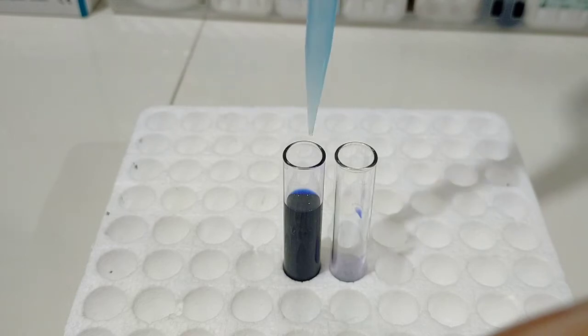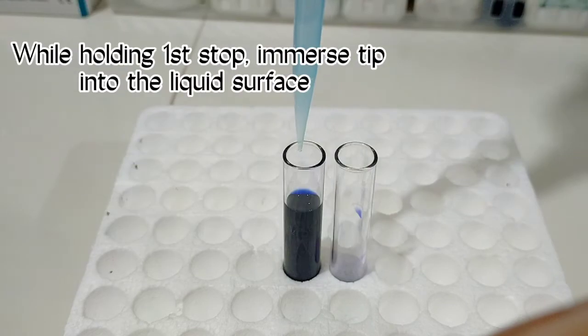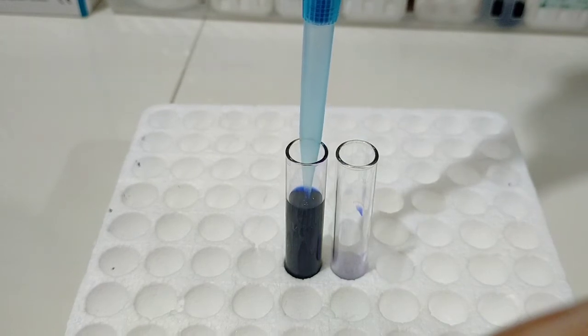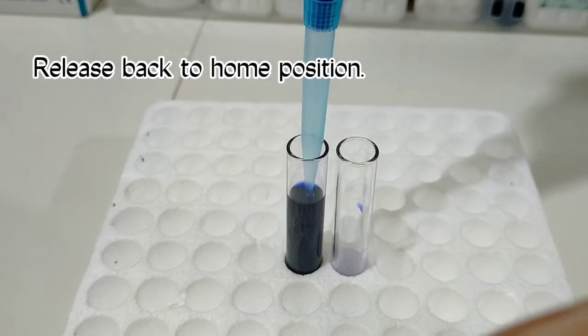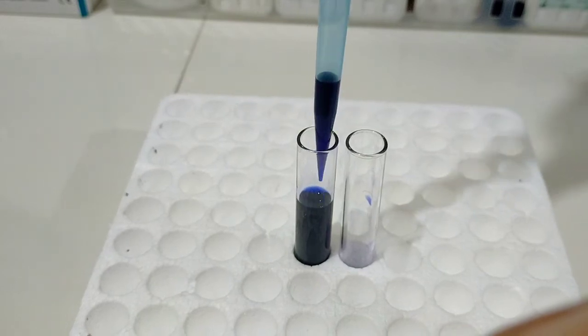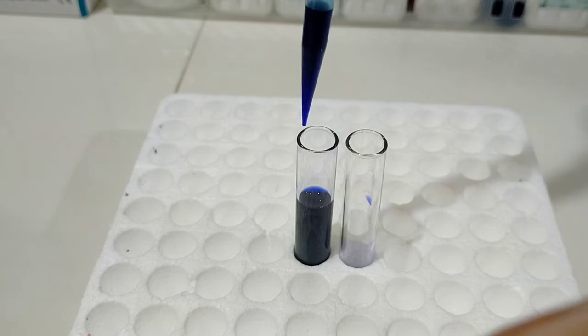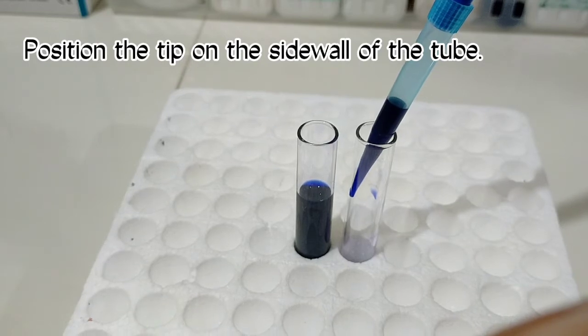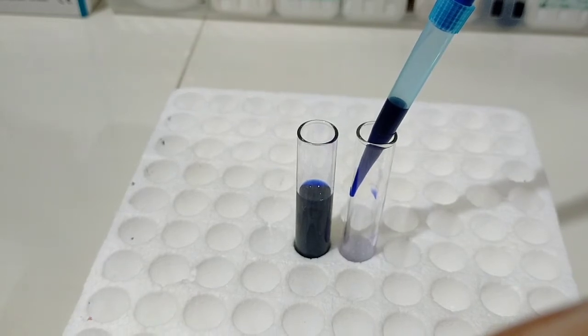Then on the aspiration, make sure that the pipette tip is immersed in the liquid surface, and then release, allowing the push button to go back to the resting position. Now, in the distribution, after releasing, distribute the liquid you have aspirated. Position your pipette tip on the side wall of the glass tube, or the receiving vessel.